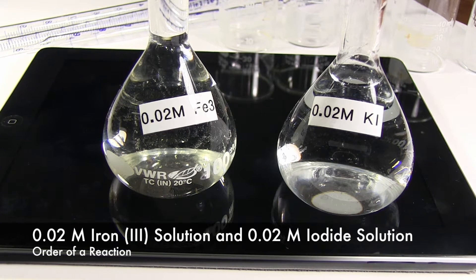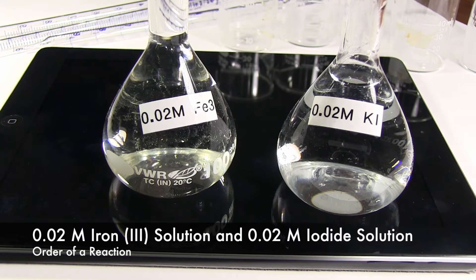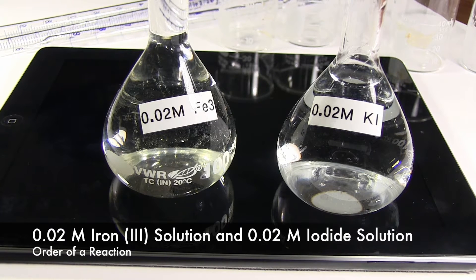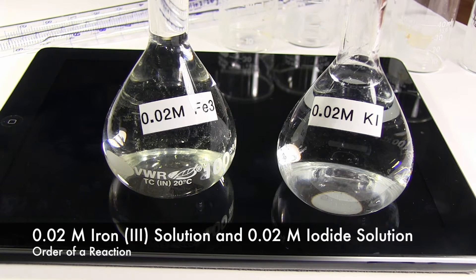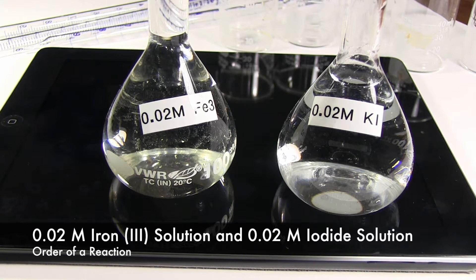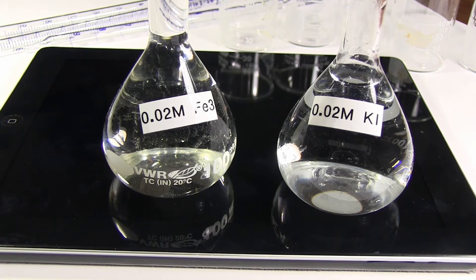Chemicals needed are 0.02 molar iron 3 solution, 0.02 molar iodide ion solution, and distilled water for dilution.